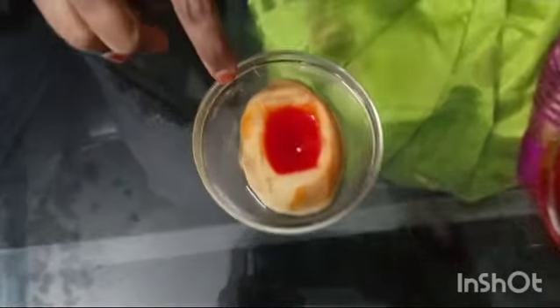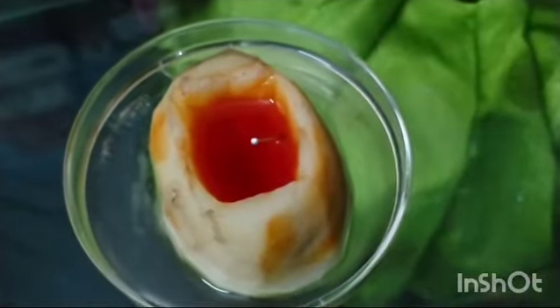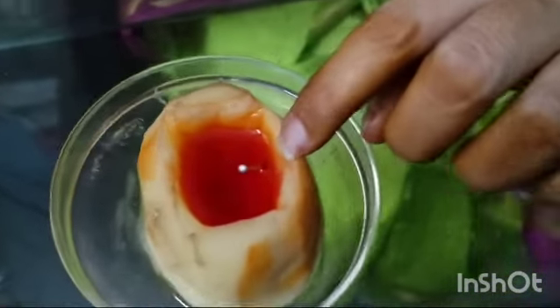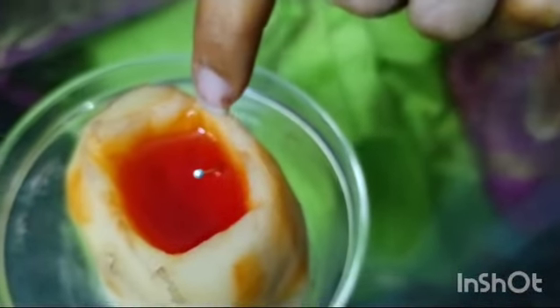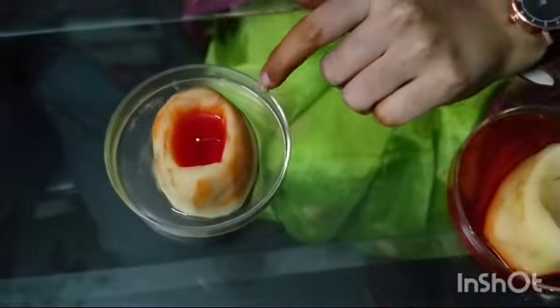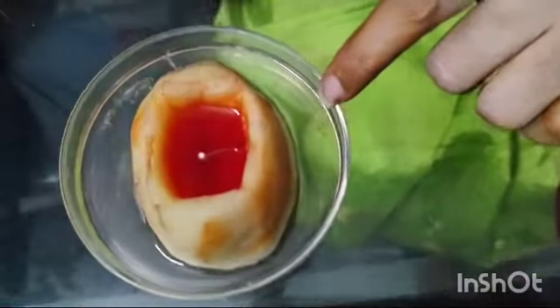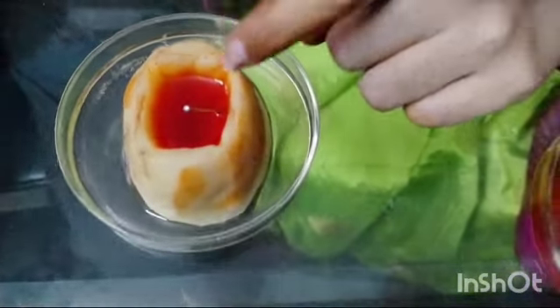High concentrated solution was in the potato cup and low concentrated solution was in the petri dish. After one and a half hours, I observed that in the potato cup, the sugar solution level has increased — we marked a pin here, but now the water level has risen above it. The water level decreased in the petri dish. The solvent, that is water, moved from low concentrated solution to high concentrated sugar solution. This process is known as endo-osmosis.